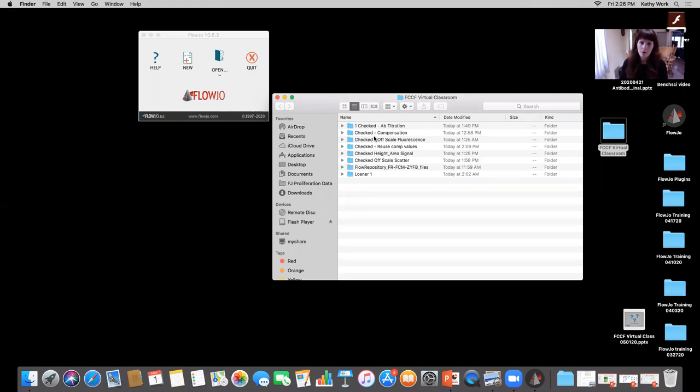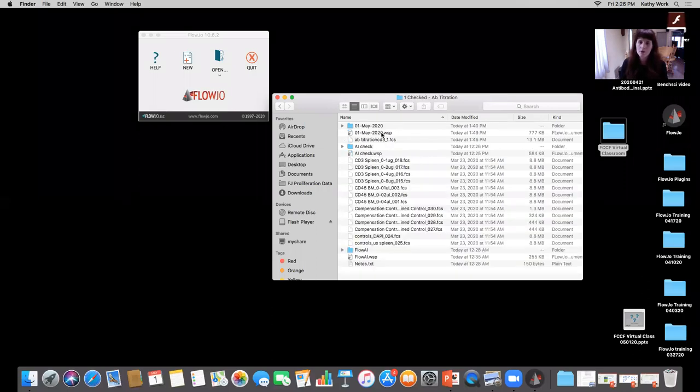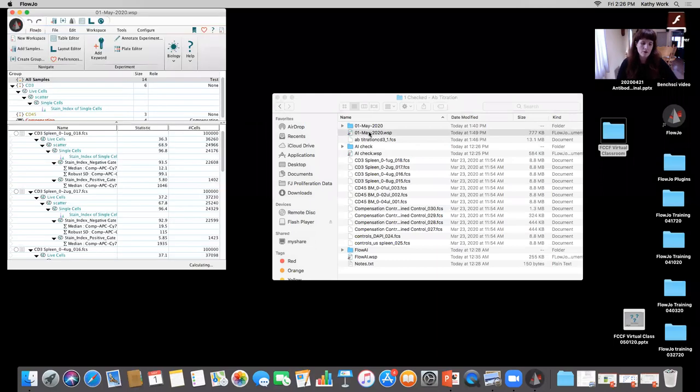not just to pull out dead cells, but also because, if you don't include a viability dye, your results are going to be off. So that's something that happens fairly often. And this researcher was wonderful. They went ahead and added in their viability dye. But what happens if you don't?